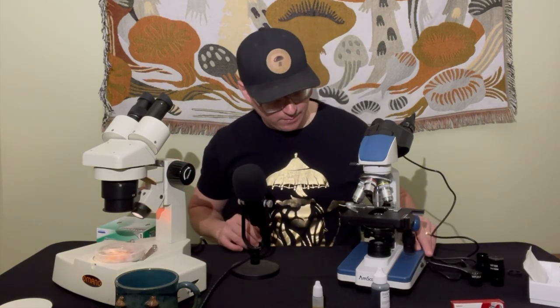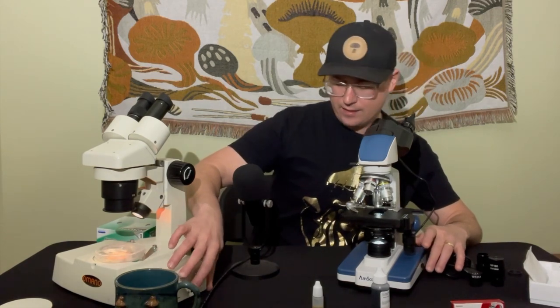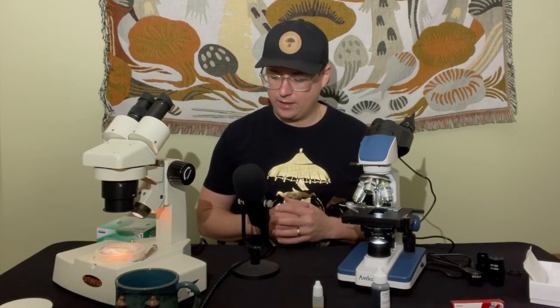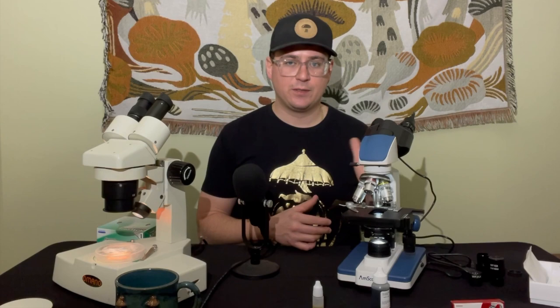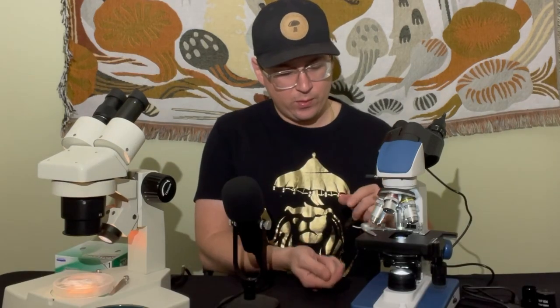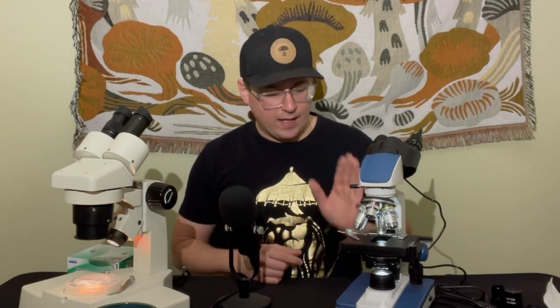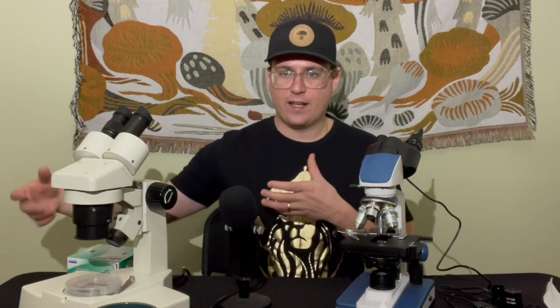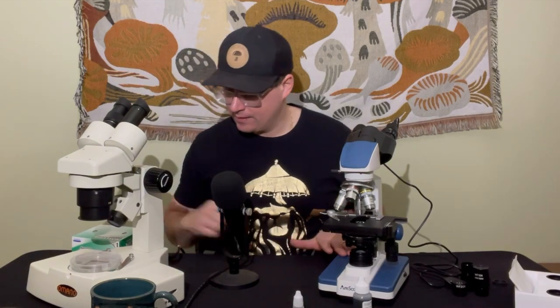Moving past the stage is the light source — a really important feature of both microscopes. There are often light adjustments on the sides of the stage to control the light strength. Both of these microscopes have LED lights, which means you don't have to worry about replacing bulbs. The light source shoots rays through the sample, through the objective, through the head, and into your eyes. Older microscopes used candles or mirrors to deflect sunlight, but modern scopes let you adjust light to your eye's comfort.